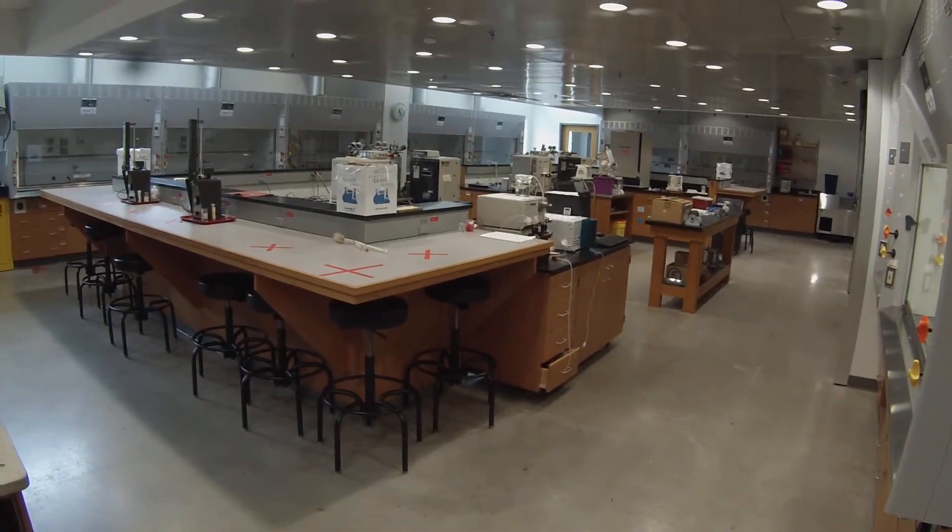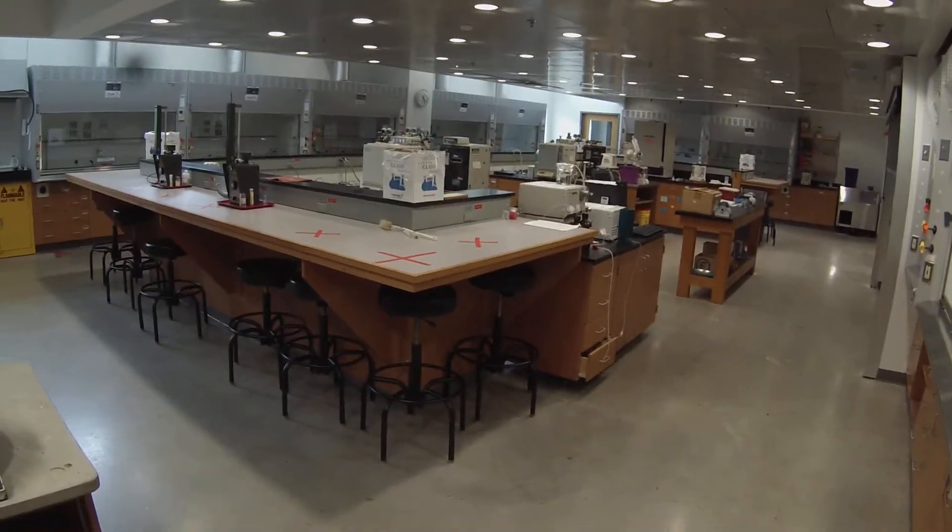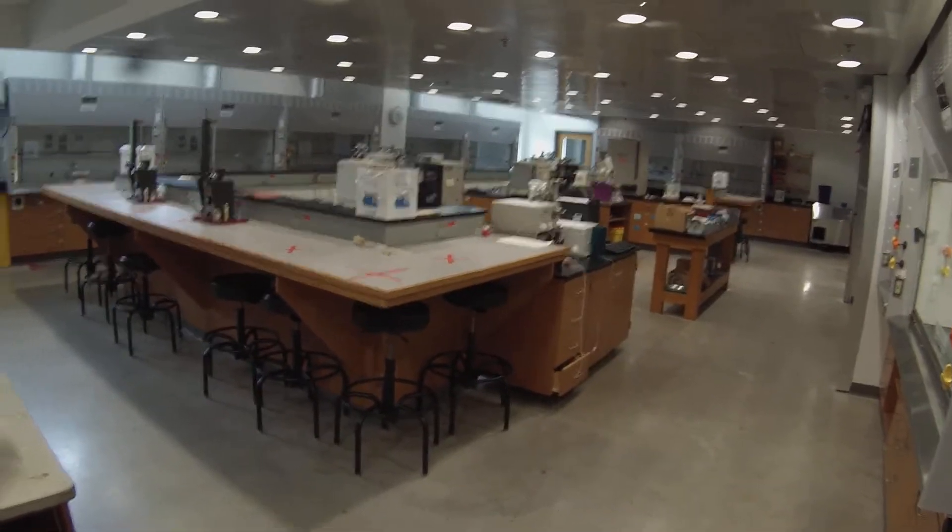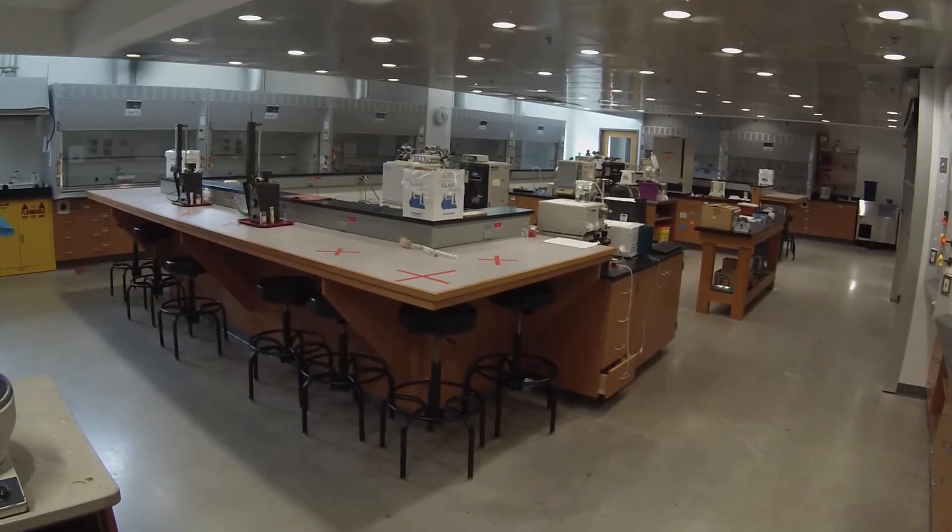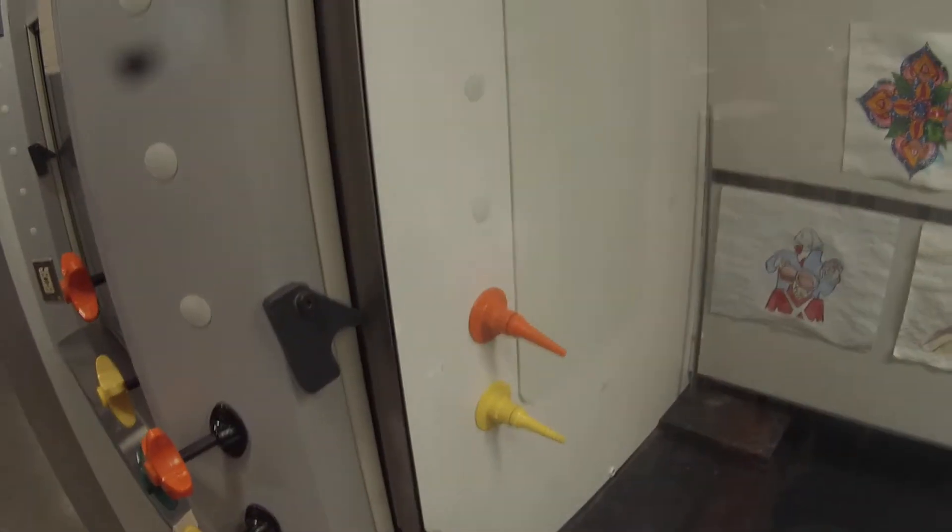Well hello everybody, welcome to your first organic chemistry lab virtual lab. Today we're going to be setting up the isolation of trimyristin by extraction with methyl tert-butyl ether. So we're in the lab here and we're going to be working in this hood number 10.